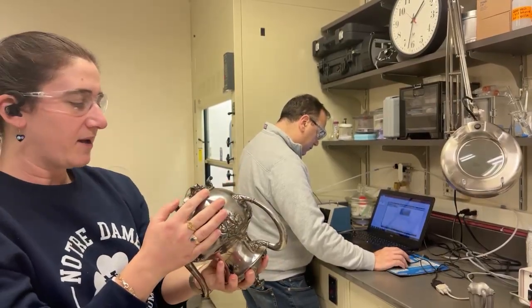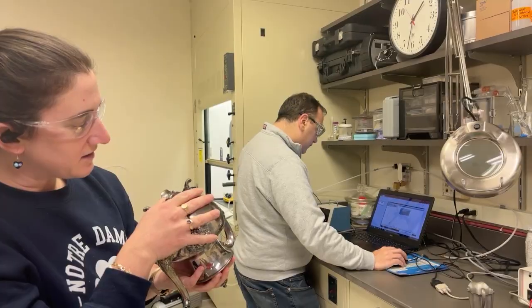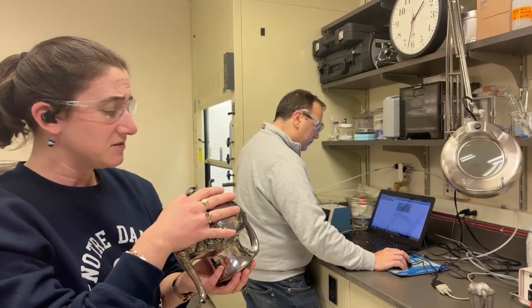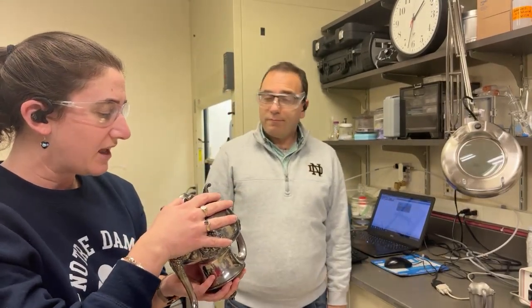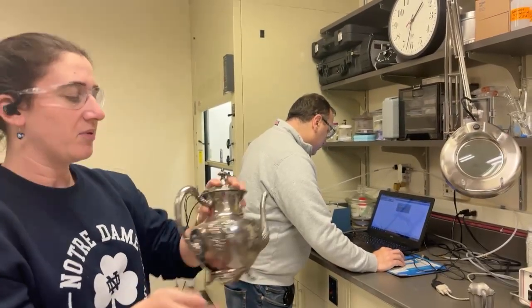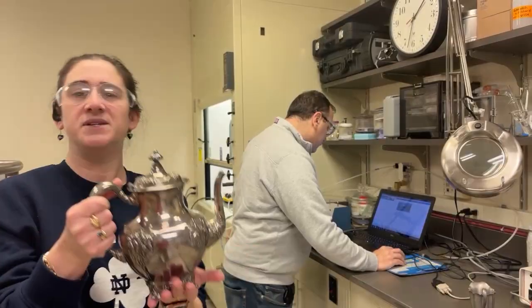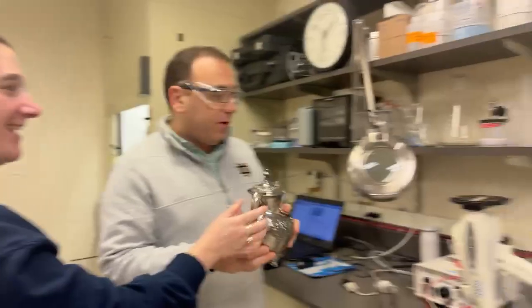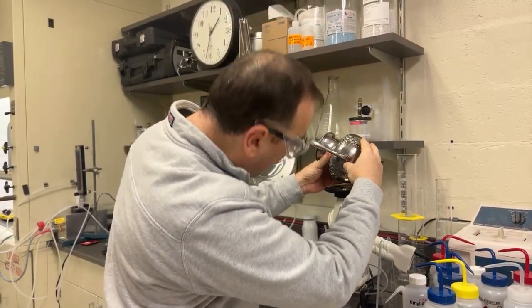So yeah, this teapot was made, it says it is Forbes Silver, CC or CG USA, Quadra something. It's pretty faded. But whatever this is, it claims to be silver. So now we're going to find out, is this teapot really silver? Does it have any elements other than silver added to make an alloy? And does it have any lead in it? Okay, we're ready.